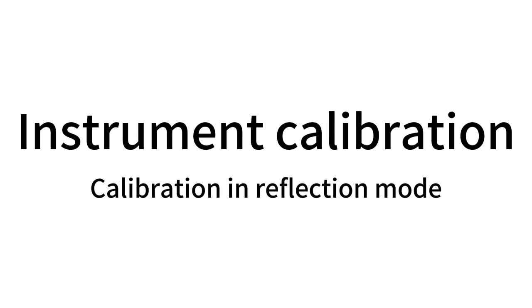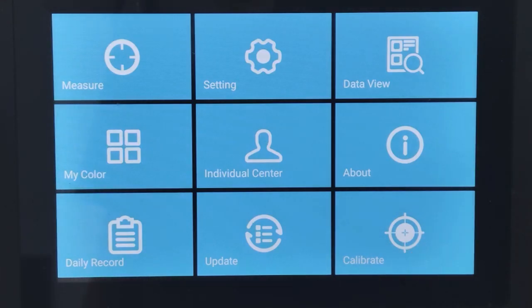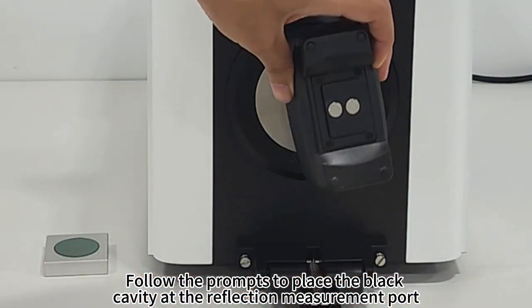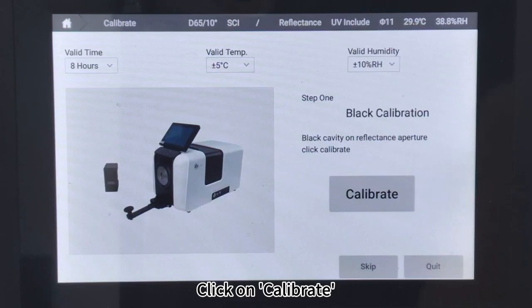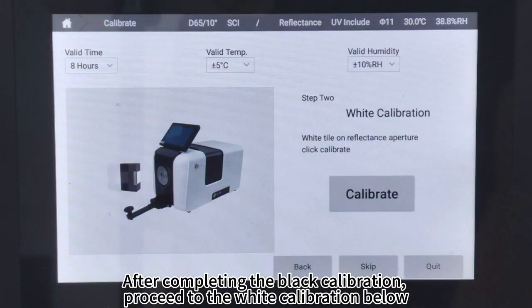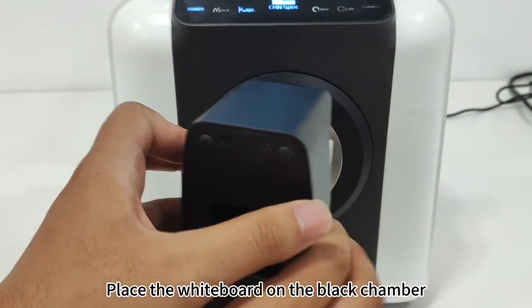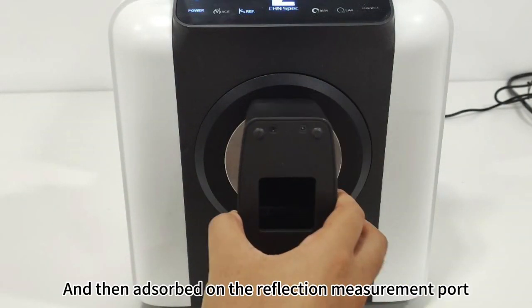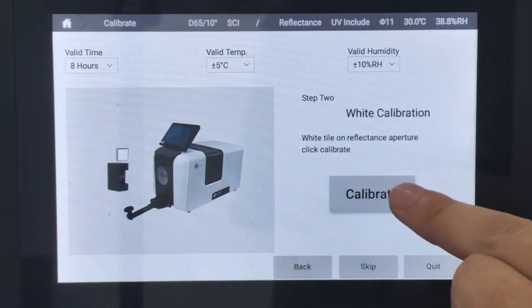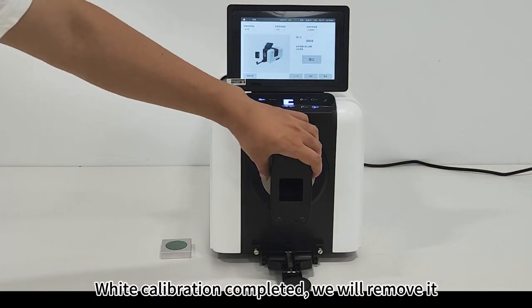Instrument Calibration in Reflection Mode. Click on Calibration on the screen. Follow the prompts to place the black cavity at the reflection measurement part and click Calibration. After completing the black calibration, proceed to the white calibration below. Place the white board on the black chamber, then adsorb it on the reflection measurement part. Click Calibrate. White calibration completed.